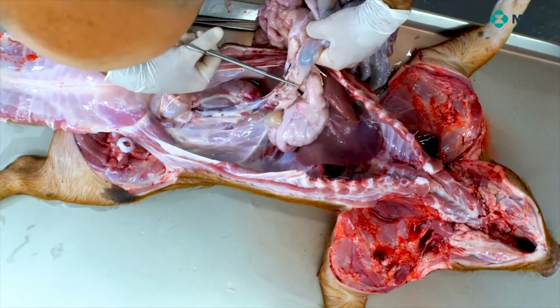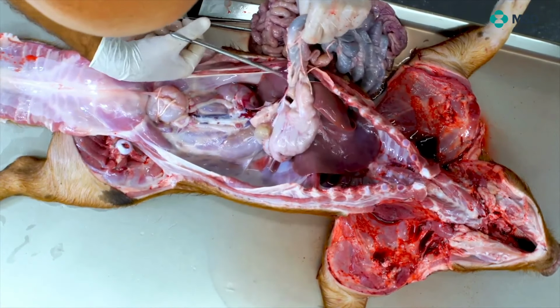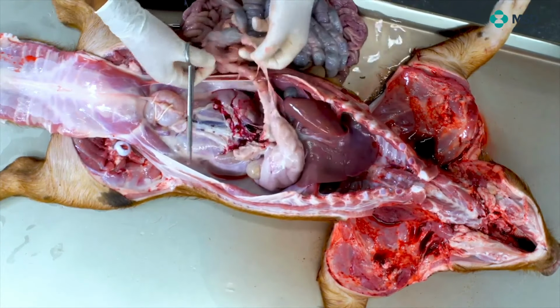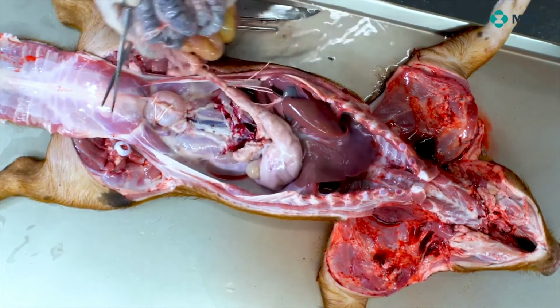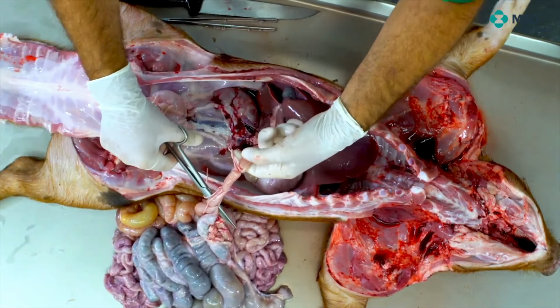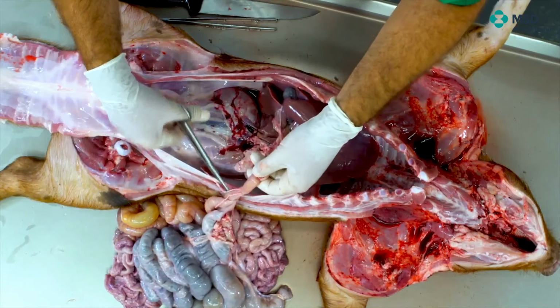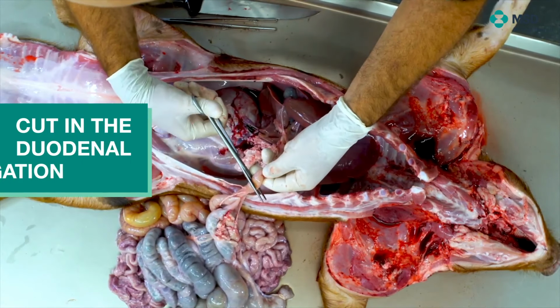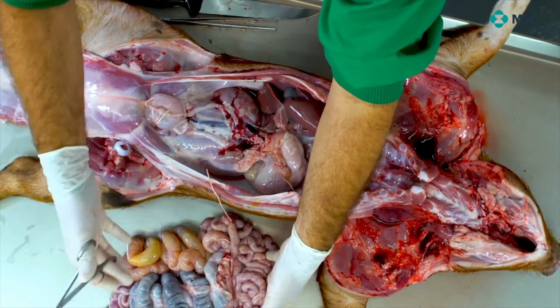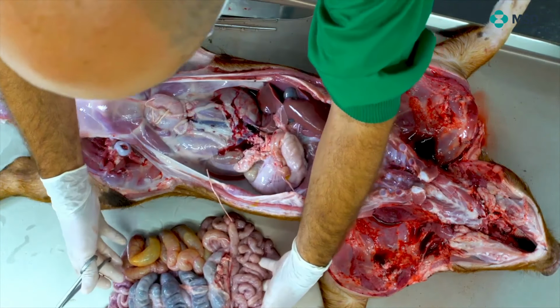If we are able to do it properly, it will reach a point in which, look, the whole intestinal mass is just touching the duodenum. So we will be able to cut at the duodenum, and then the whole intestinal mass is ready for the thorough study. So we will leave it that way.